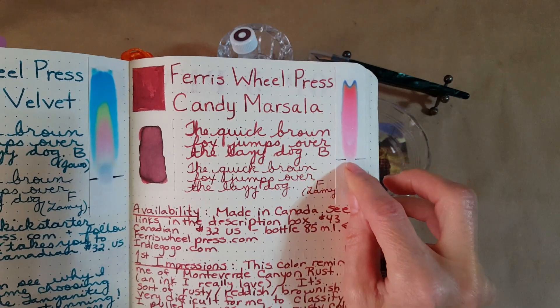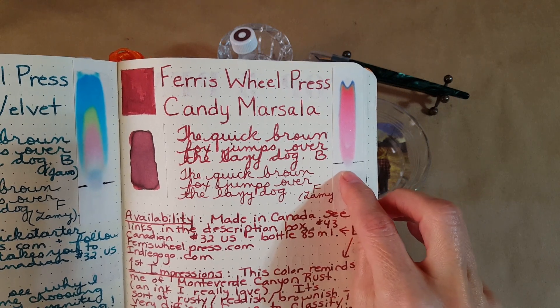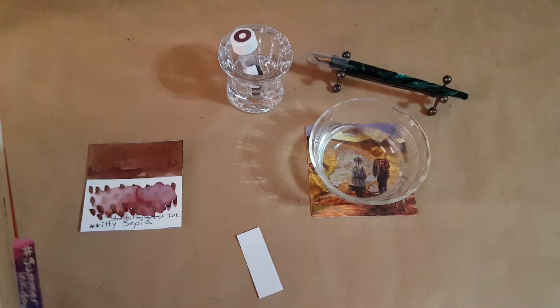Okay, first let me show you what I used to do. I used to do it by making a dot and I made a little line here so I'd know where my dot was. And that was nice, I mean it gave me some information for sure.